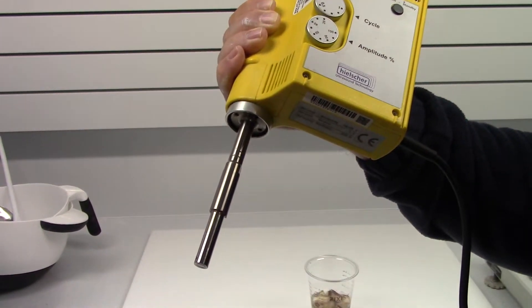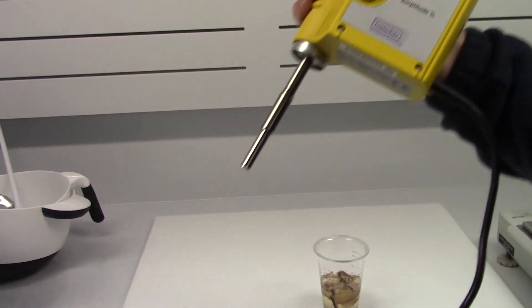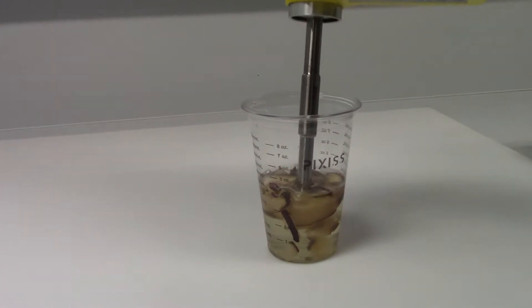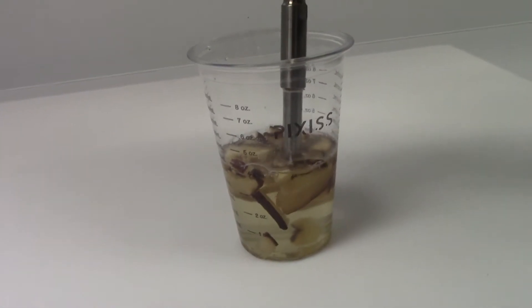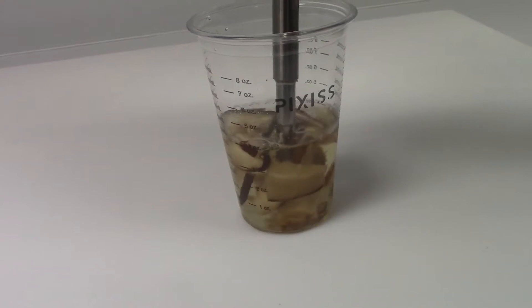It's got an MS10 sonotrode on it. And to demonstrate how it would work, you'd put it into a solution and start the sonication process.